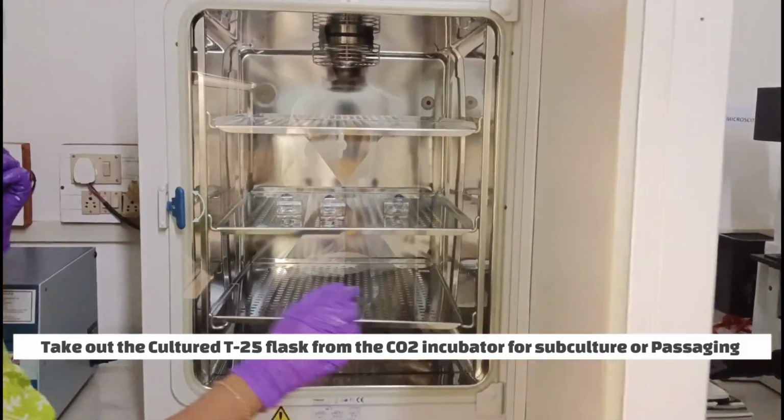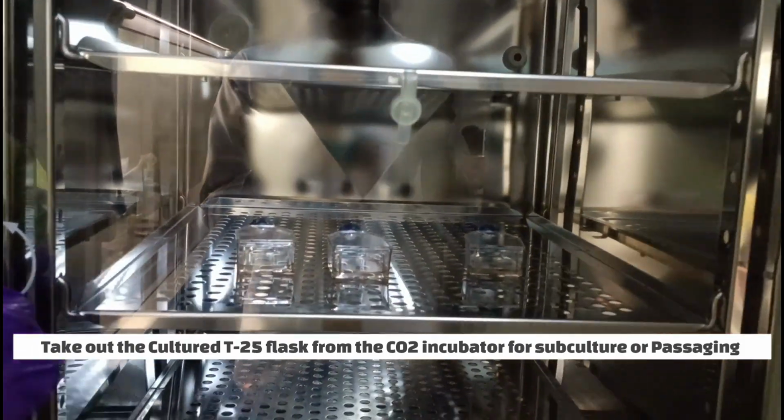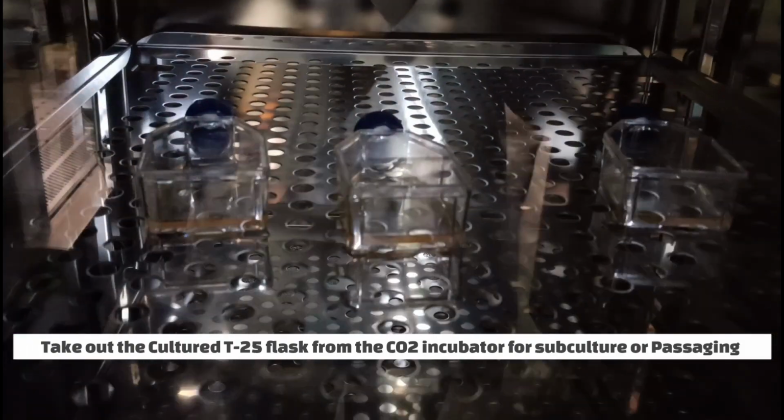Subculture or passaging. Take out the cultured T25 flask from the CO2 incubator for subculture or passaging.